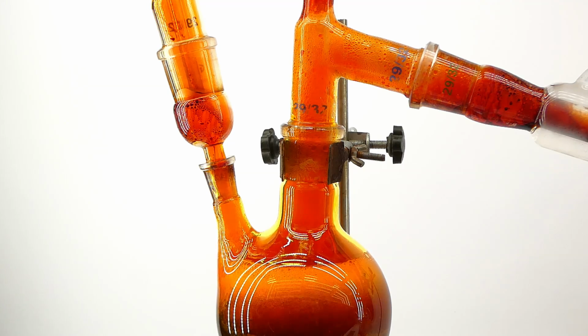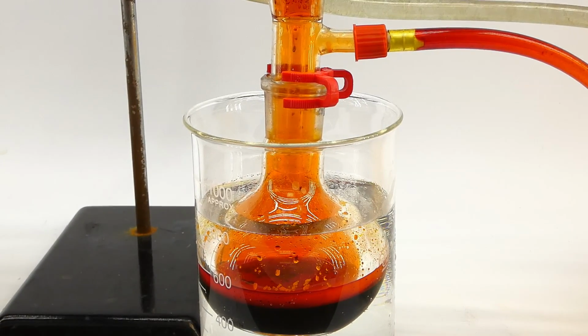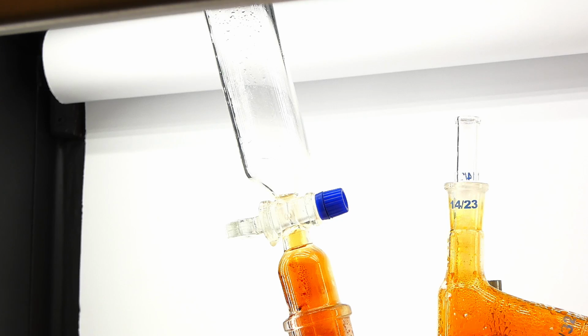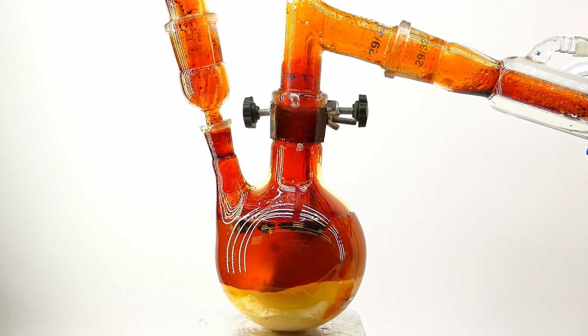After a few hours, I have collected quite a bit of bromine in my receiving flask. An overflow did also happen when I wasn't looking, and some of the reaction mix got onto the bromine, but this shouldn't be a problem since I will carry out a few cleaning steps later. Anyway, when the dripping funnel ran out of sulfuric acid, I added some more for good measure, and after a few more hours, the reaction seemed to be nearing completion.